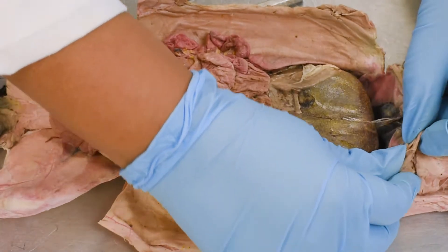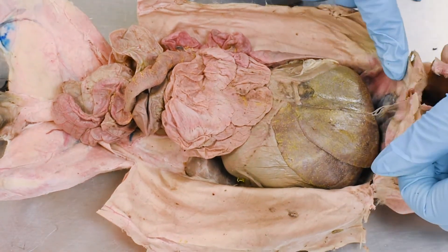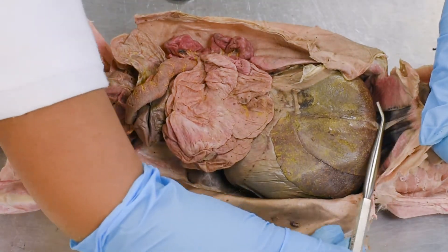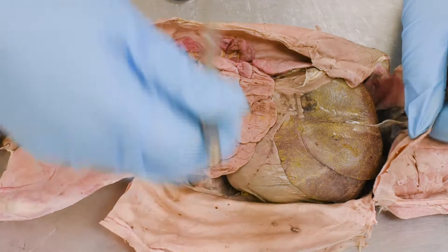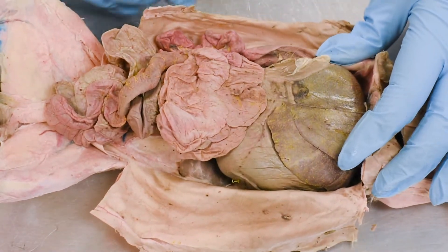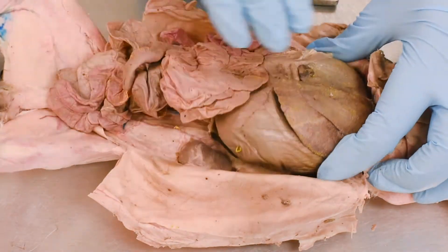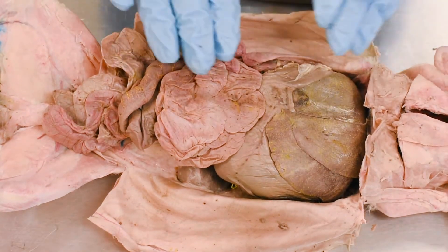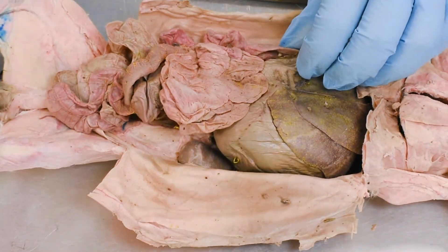Now we will look below the diaphragm, or inferior to the diaphragm. This is the muscular structure — that's the diaphragm. Before we actually start cleaning the blood vessels, I would like to go over the organs first. Once you know the organs, it will be a lot easier to follow the blood vessels.